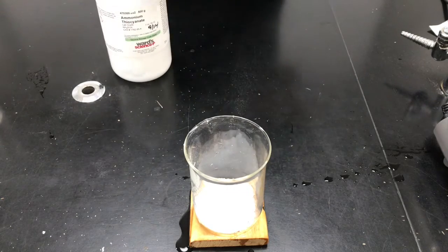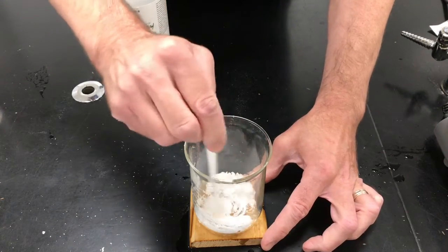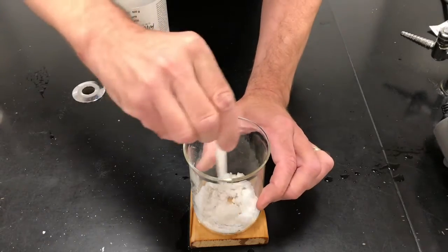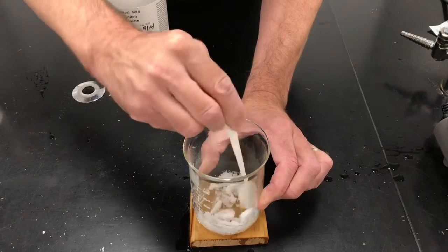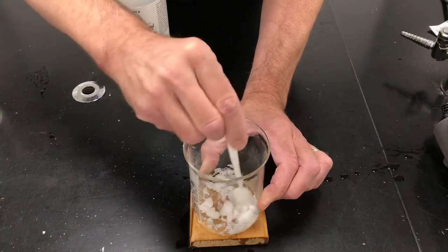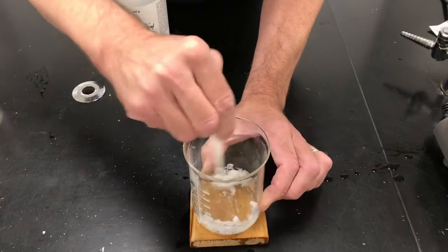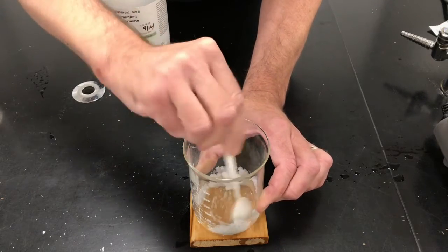All right. Now, I'm going to take these two chemicals and I'm going to mix them while they're in the beaker. Okay, I'm going to let them sit a second, right there. All right, so they're in the beaker, I'm mixing them, and you'll notice you start to get a little, well, things are happening, they're changing. It's getting a little slushy in there.